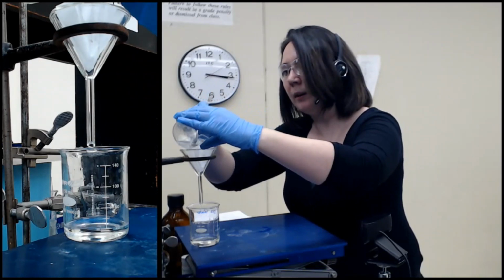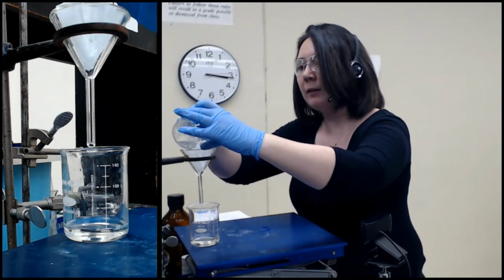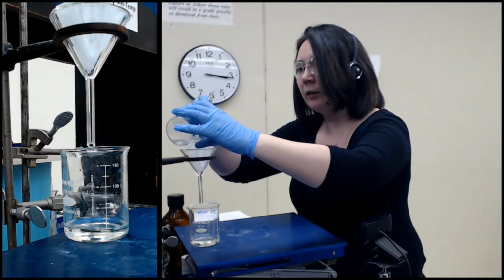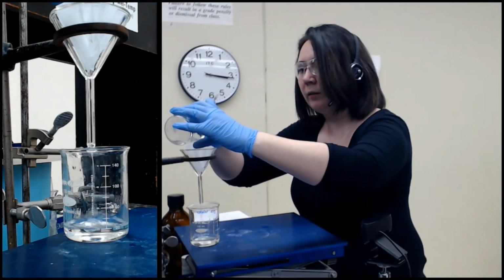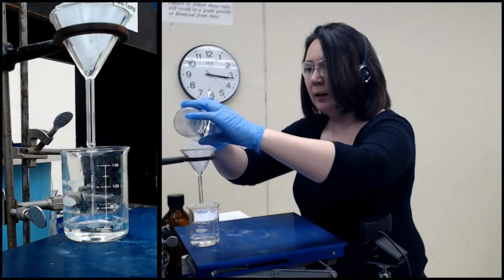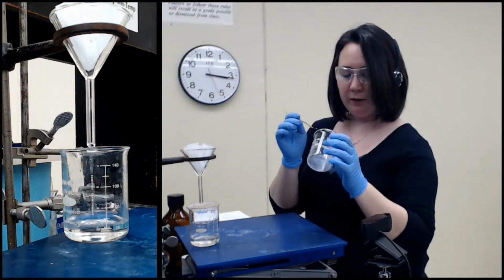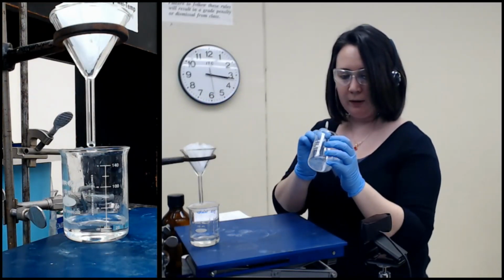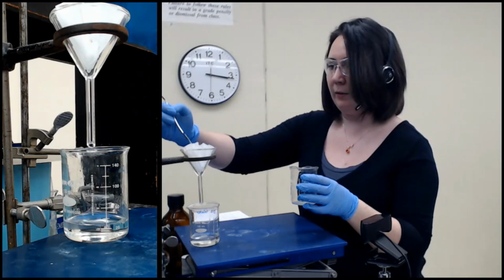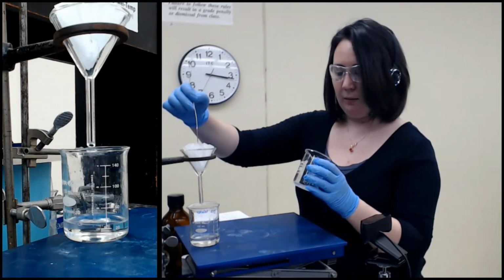Try to do it without breathing in ethyl acetate. Some of you may be familiar with ethyl acetate. It's the alternative to acetone that you can use to take fingernail polish off your nails. I prefer acetone because I think ethyl acetate smells like feet. I love it. Okay, got most of it out. There's a little bit on the bottom, but I am not worried about it.